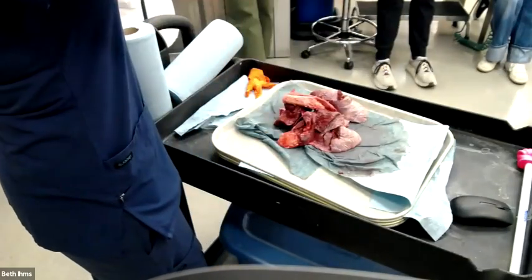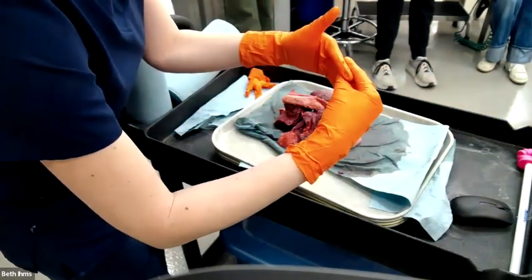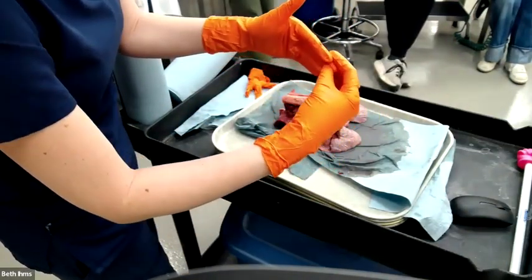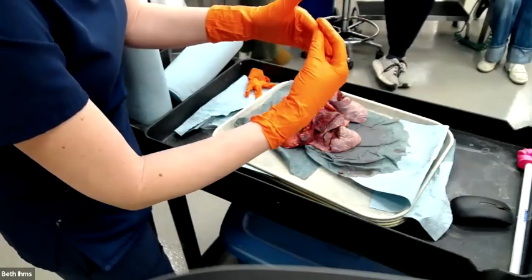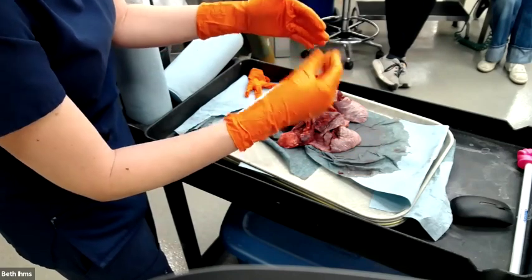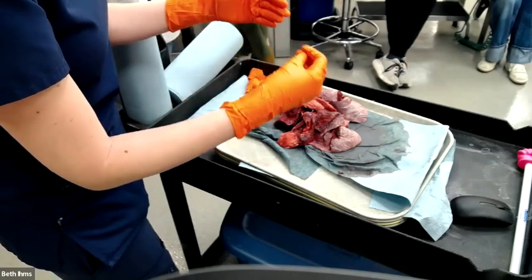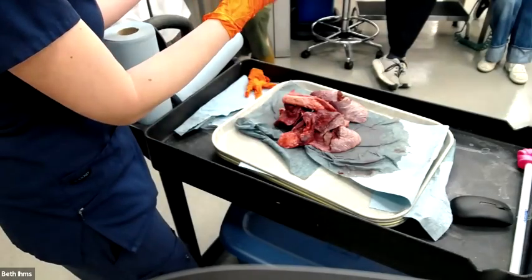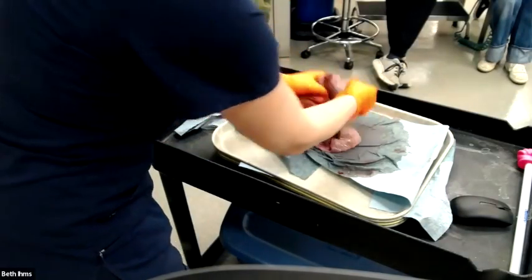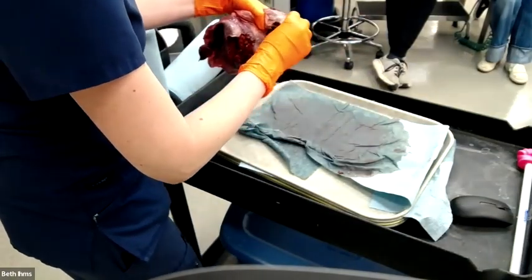All right, so you're gonna take your lung, you're gonna, my hands first. This is your lung. You're gonna go like this and let it just gently slide through your fingers. And you're feeling for a couple things. So it's a texture thing. You're feeling how soft, are there any lumps or bumps or nodules in here? And then also, can I feel the normal crepitus of the lung, which is the little air bubble alveoli popping? That's normal. A normal lung should have crepitus. So when you feel it like this, you're feeling for those little Rice Krispie bubbles popping.